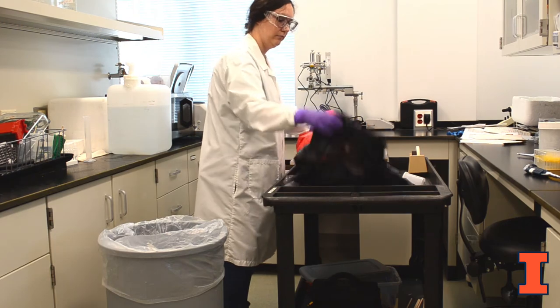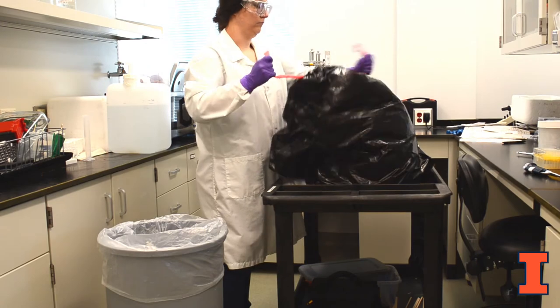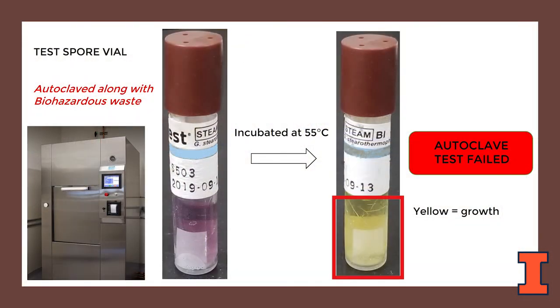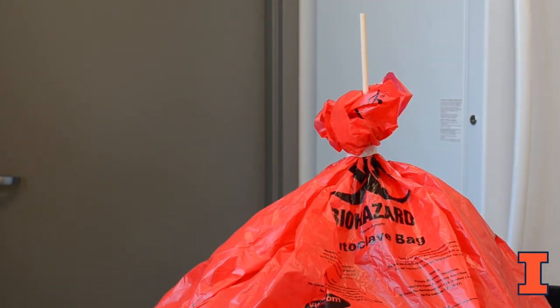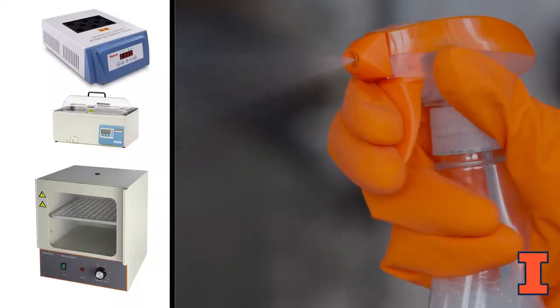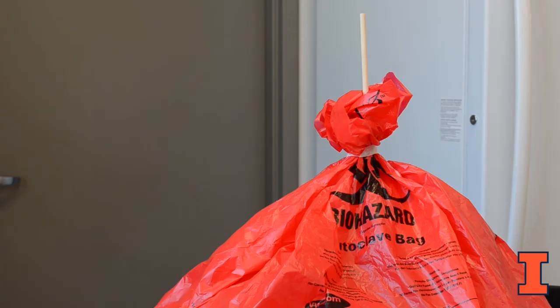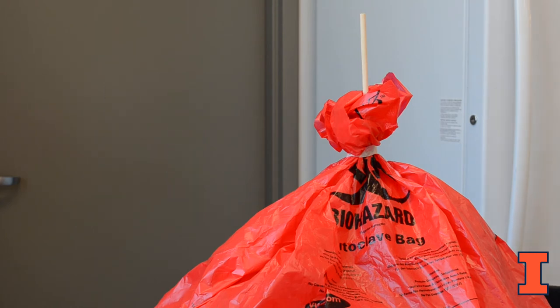You can now place your biohazard bag in an opaque trash bag, seal the bag, and discard it in regular trash. If your autoclaved test spore vial turned yellow after incubation, the spore vials were able to grow and failed the test. This means that the waste was not fully decontaminated and must be re-autoclaved with a new spore vial. Decontaminate the incubation heat source used and any surfaces that may have been in contact with the vial with the disinfectant approved in your IBC registration. Discard any vials with growth, including the failed and control vials, in a biohazard bag to be autoclaved later.